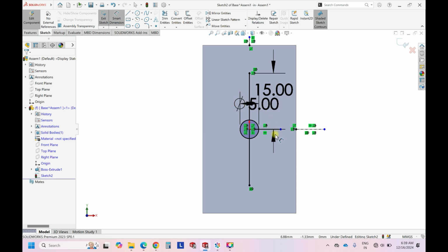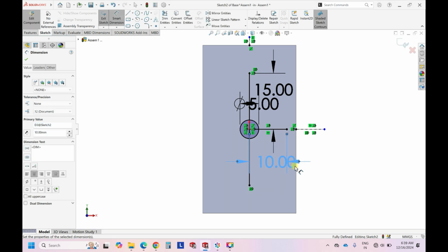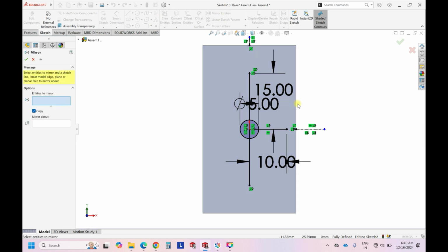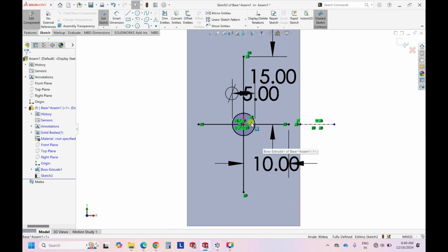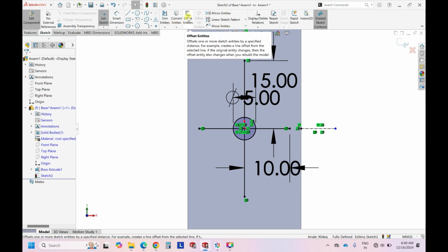We can have the dimension as, so we still have space, so let's keep it as 10 mm. And same way now we can mirror this entity over this line. Okay, done. So now this is ready. So the channel is not ready, but however this is ready. So next we do is offset entities.